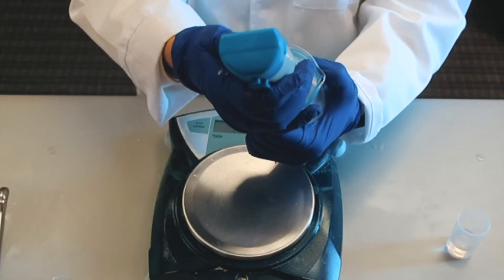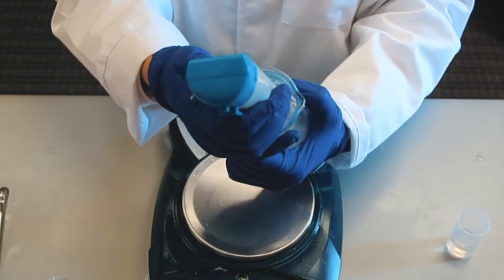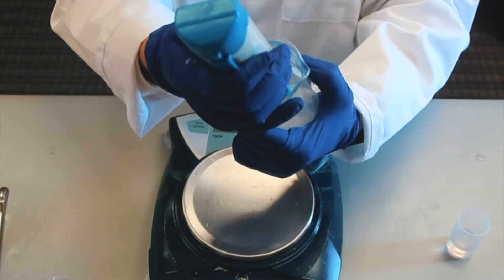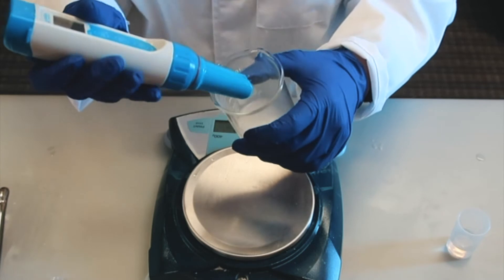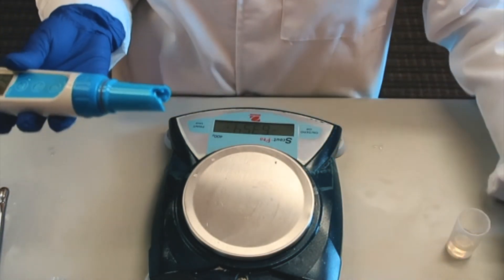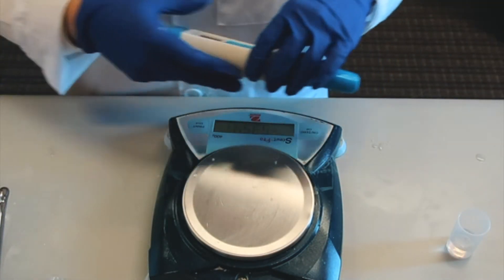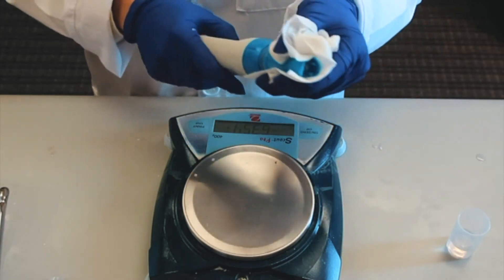So then I just measure the pH. This cream has a pH of 5.66, which I consider fine.